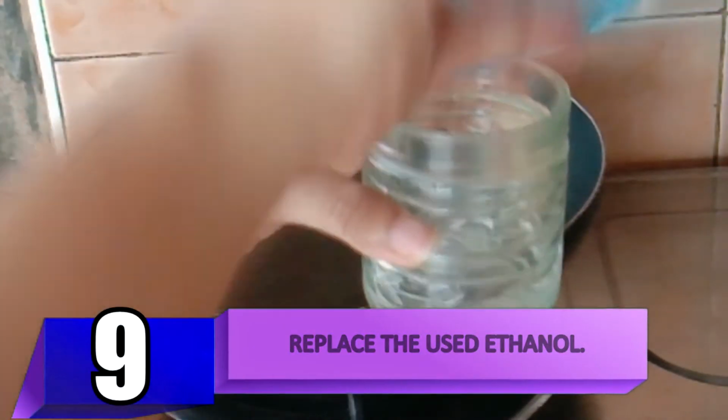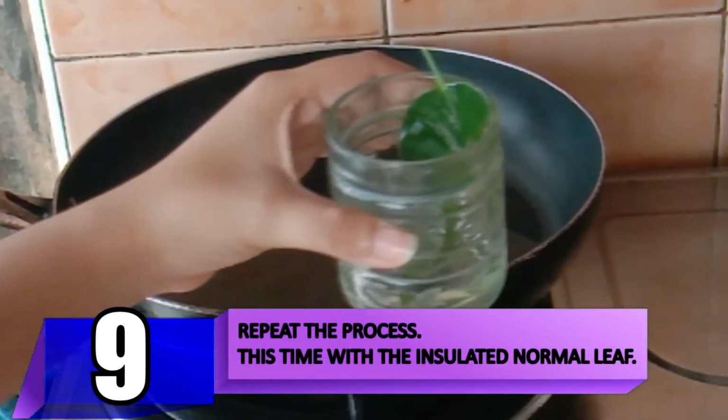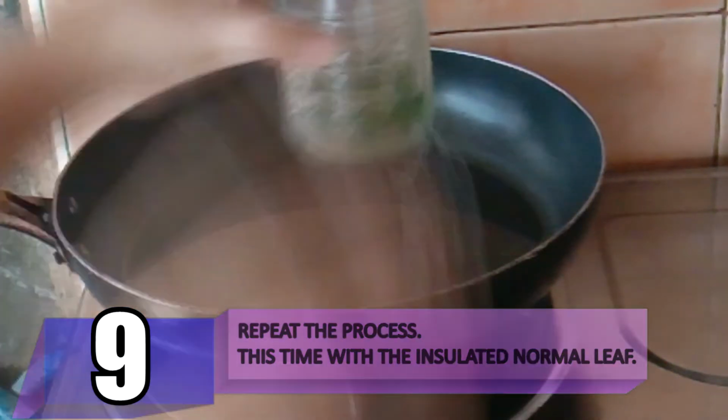Replace the used ethanol and repeat the process using the insulated normal leaf.